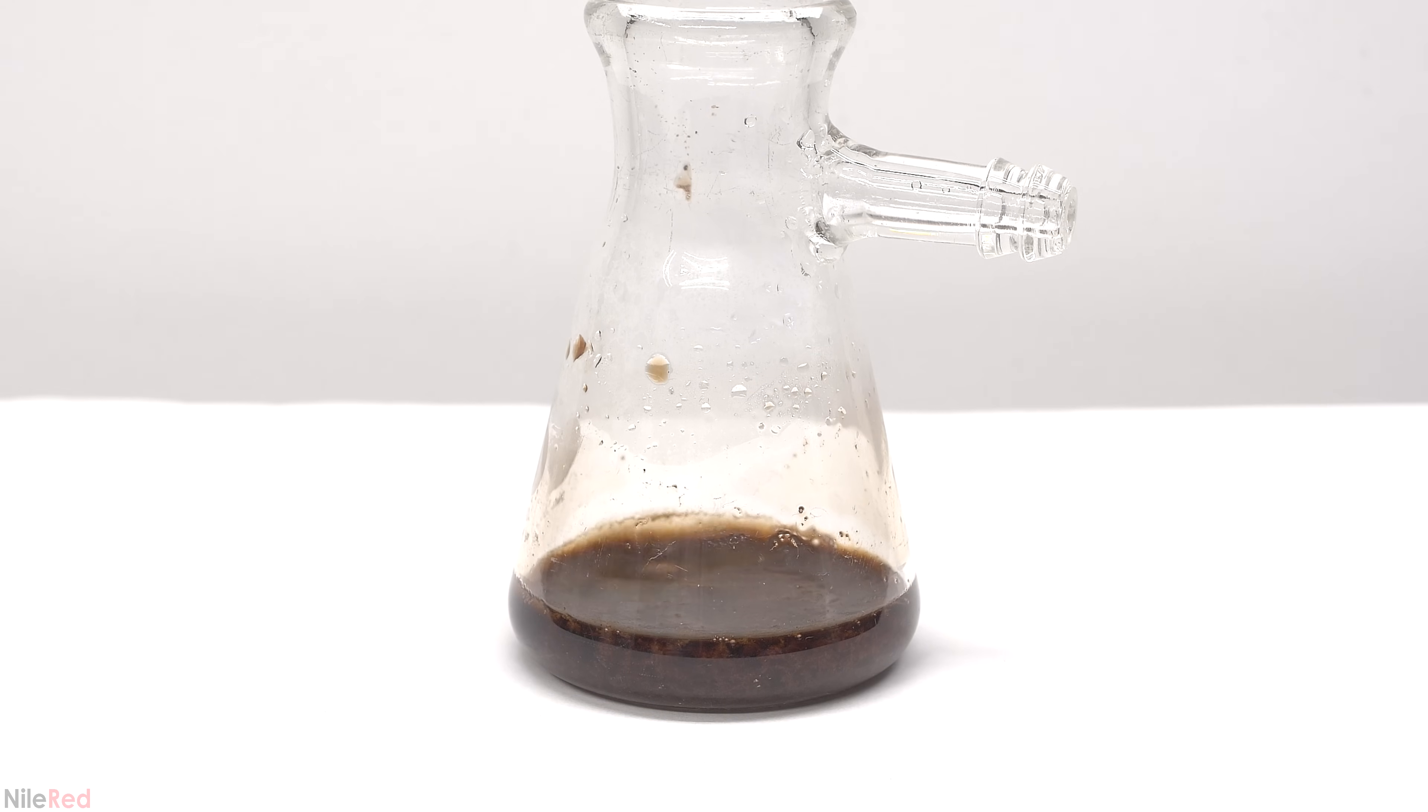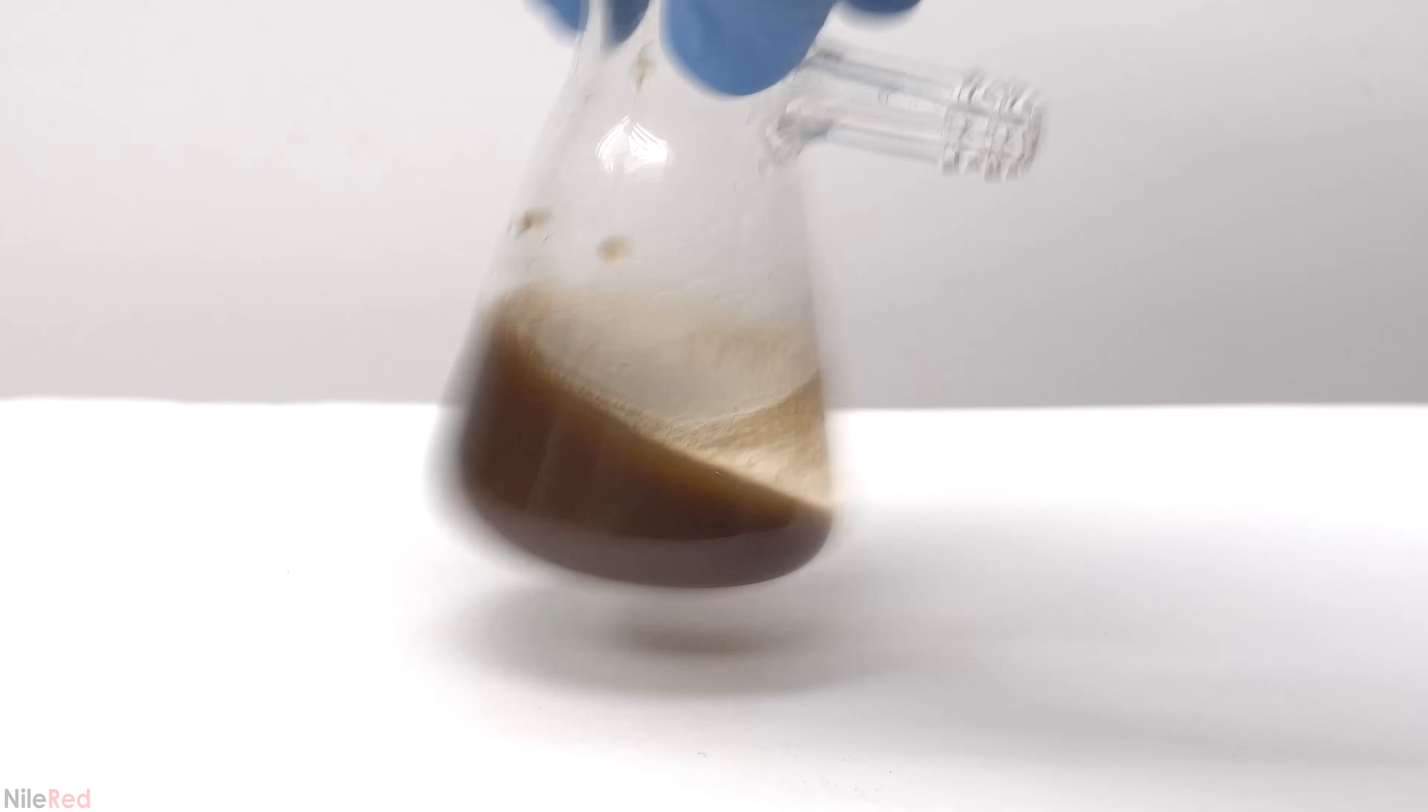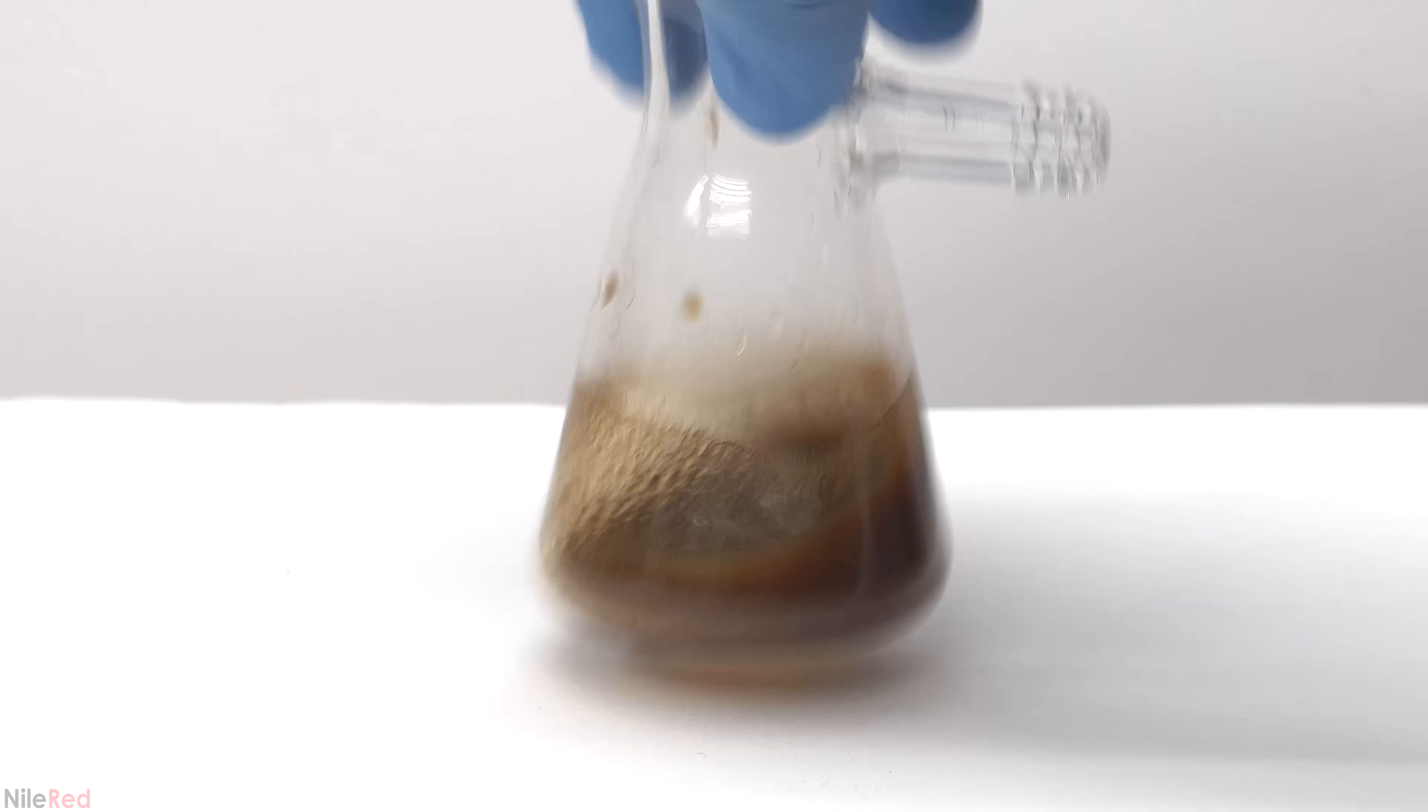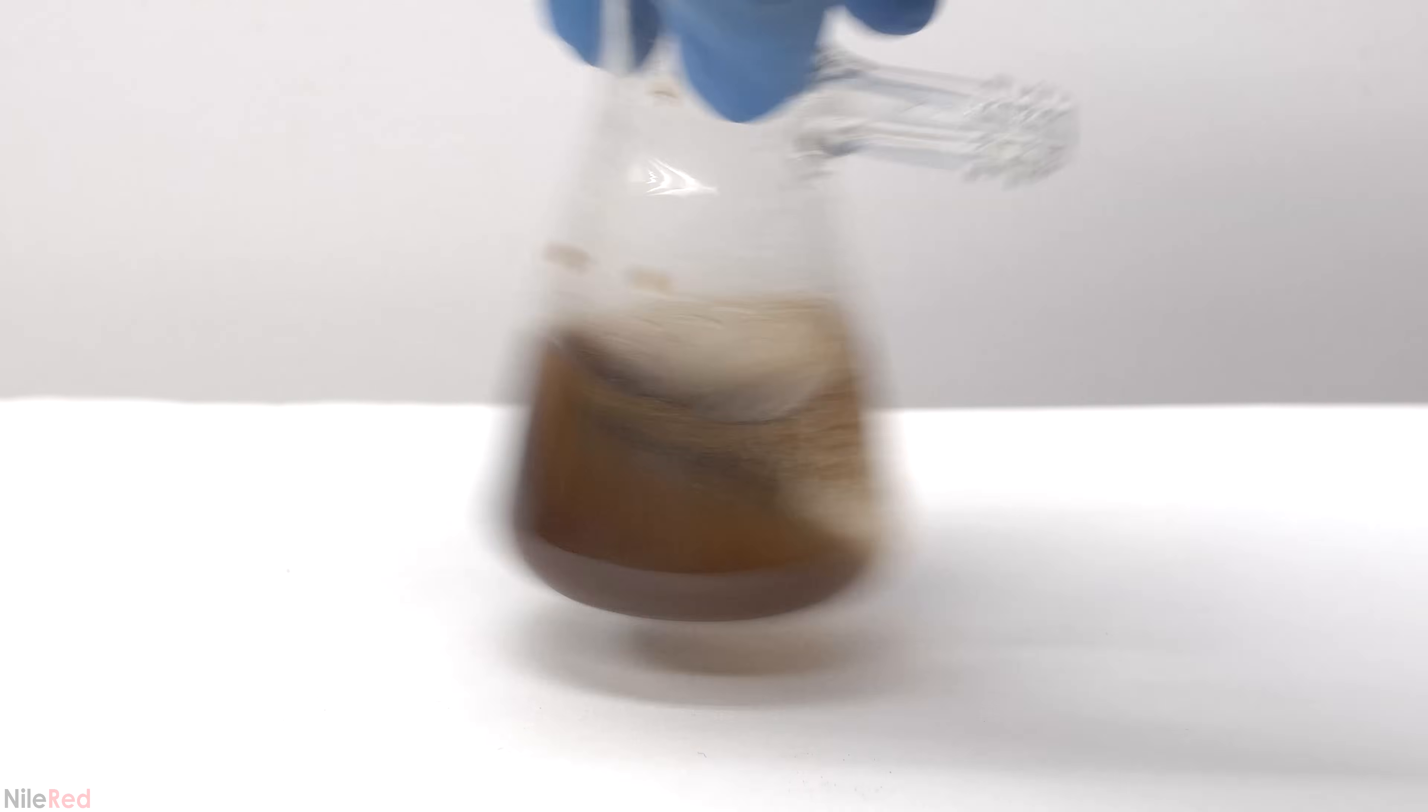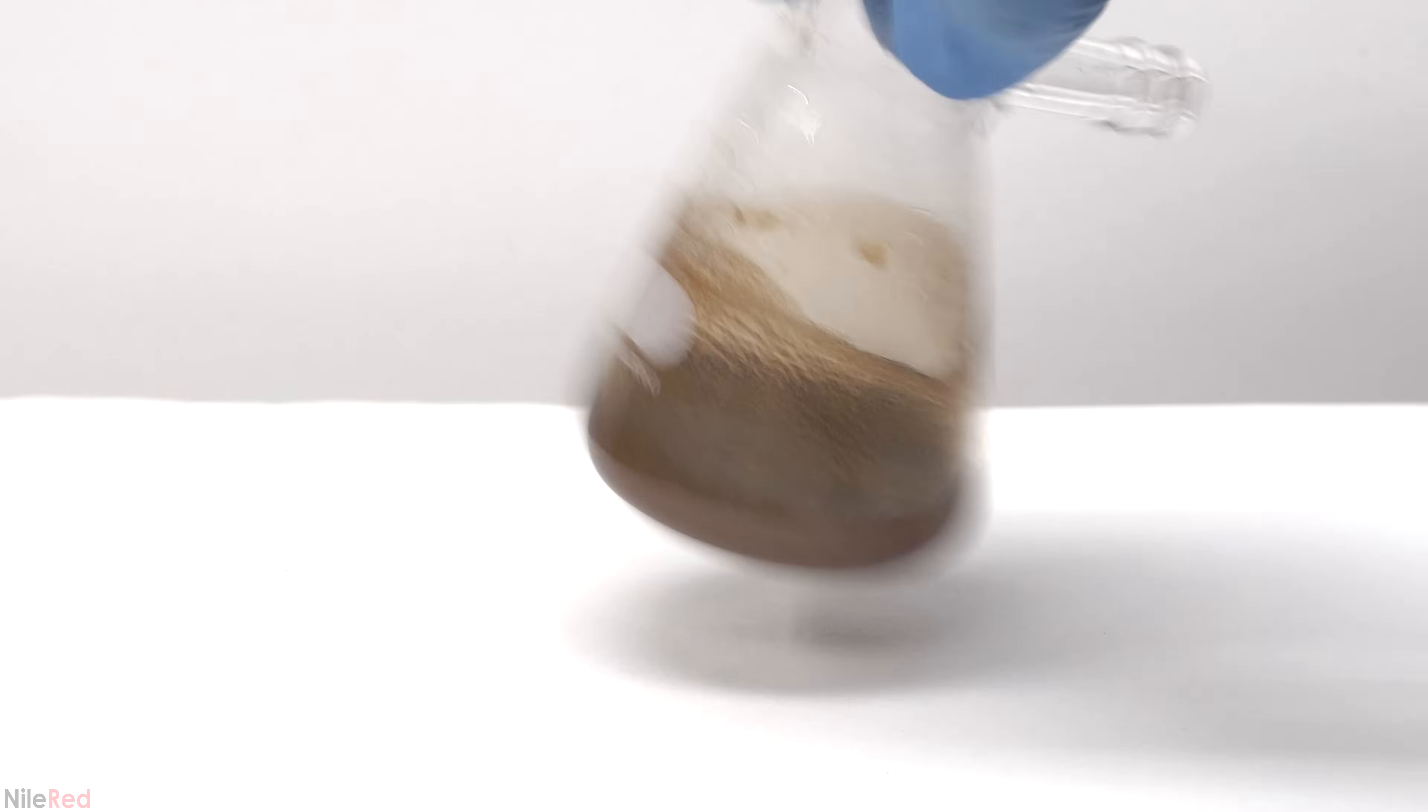Coming back to the preparation, it took about five minutes for some solid to start forming. The solid that's precipitating out is our desired paracetamol, and as I continue to mix it, it seems like more appears. It's then mixed for the next 15 minutes or so to make sure the reaction goes to completion.